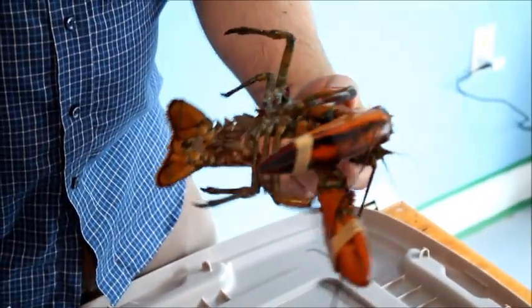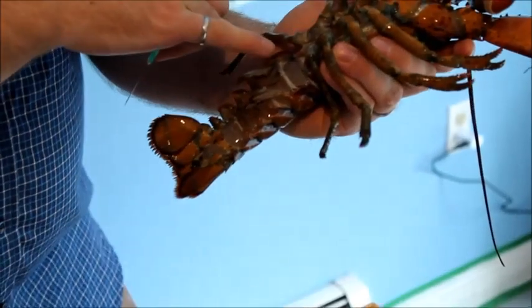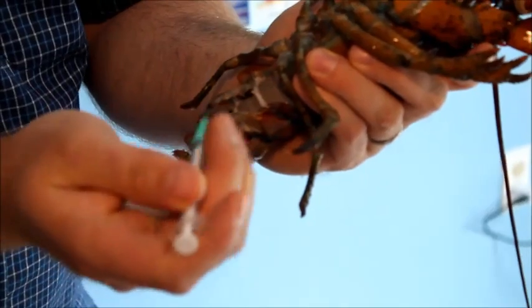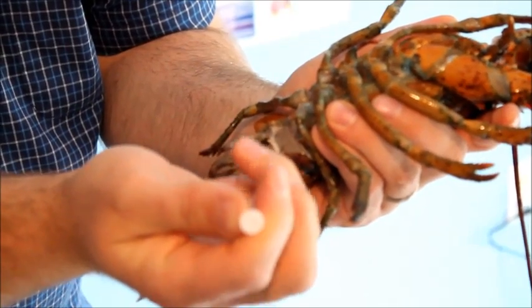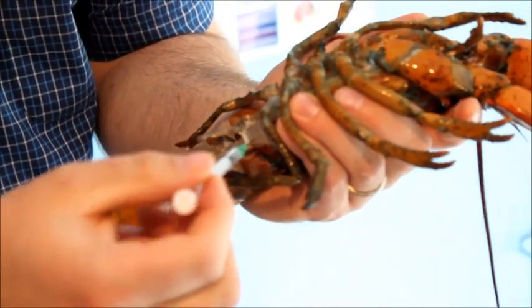Pick up your lobster, turn them upside down, and you want to insert the needle in the soft part of the abdomen where it looks like there's fluid, just enough so you're under the skin. You need between a quarter and a half a ml of fluid.